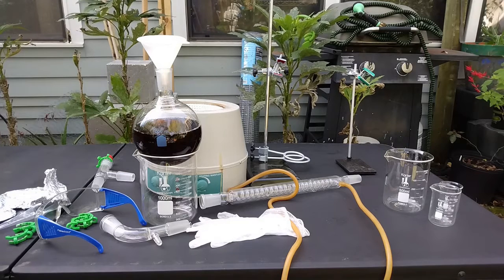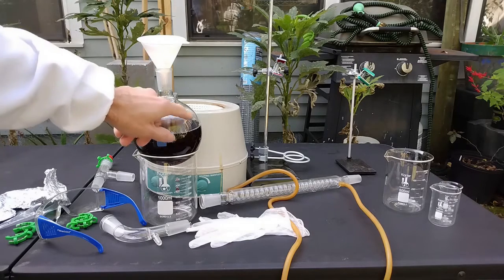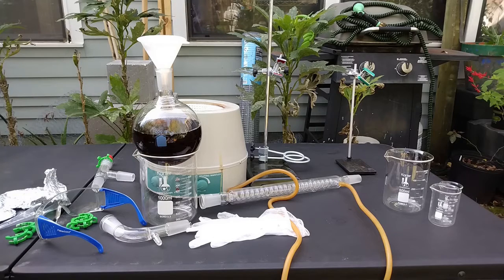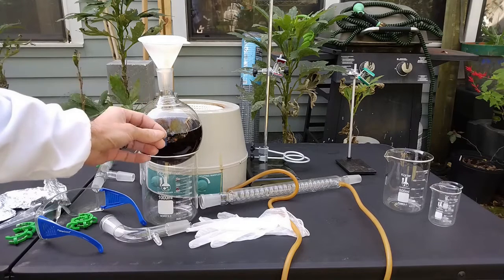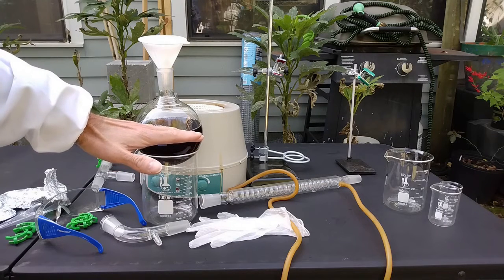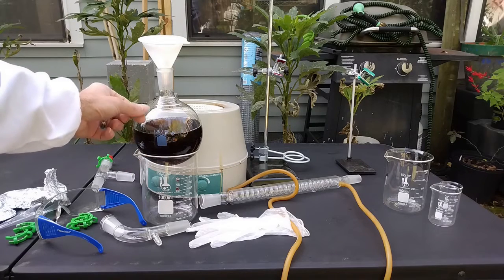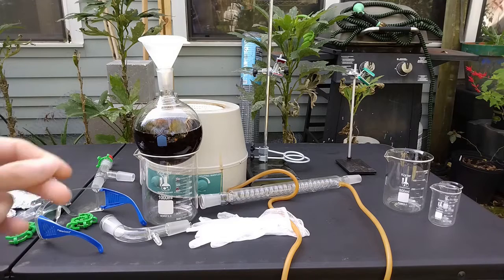Although this is Pyrex, we are going to deal with relatively high temperatures — the boiling point of sulfuric acid is 337°C — so that's high stress on the Pyrex and it can shatter at any time. To avoid bursts, I'm going to put some broken glass pieces in the flask. The liquid may overheat and not boil for a while, then suddenly produce very big bubbles that could shatter the glass. The broken glass pieces help make the boiling smoother.